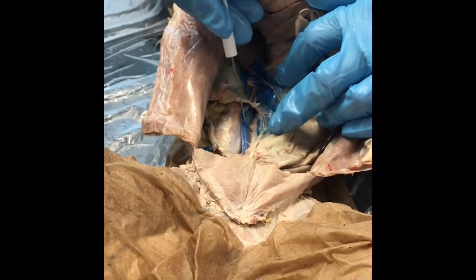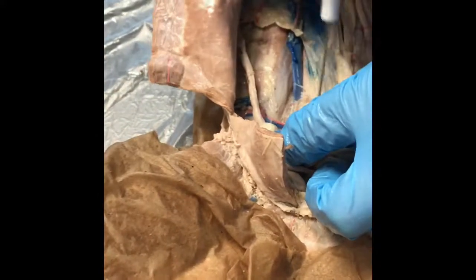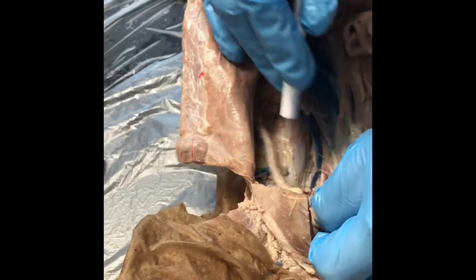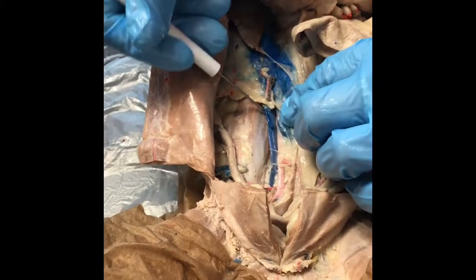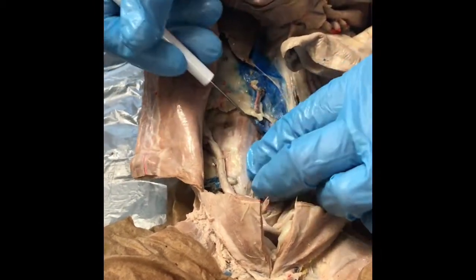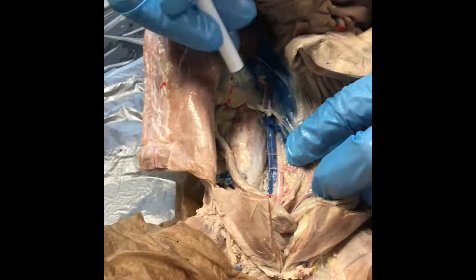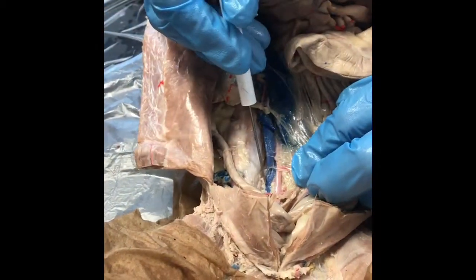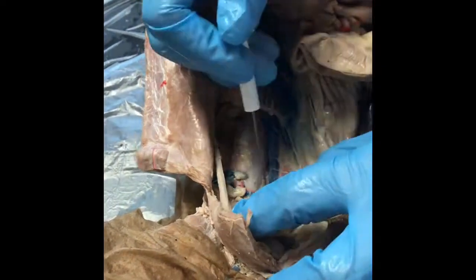Okay. Yep. Then, Aaron and Tess were in yesterday. So, this was an issue. And it's very hard to find. But if you notice, I've told you guys that veins are superficial to arteries. That is true until you get all the way down here, right here. And then if you look, the artery flip-flops and goes on top of the vein. And so the iliacs are very difficult to find because of that.